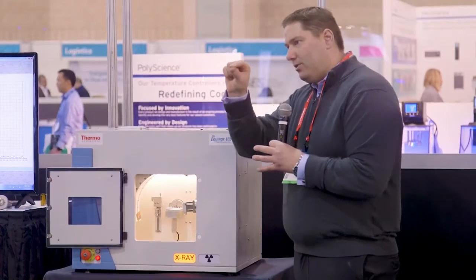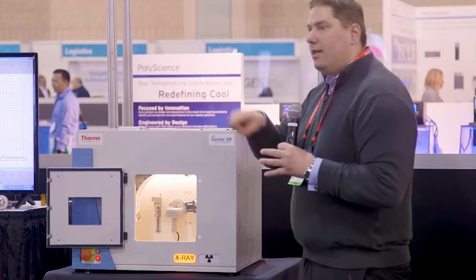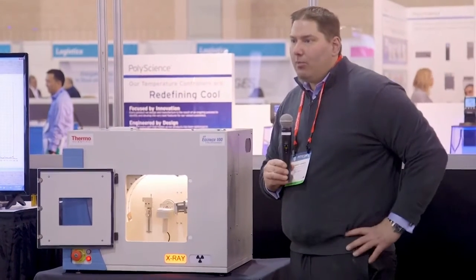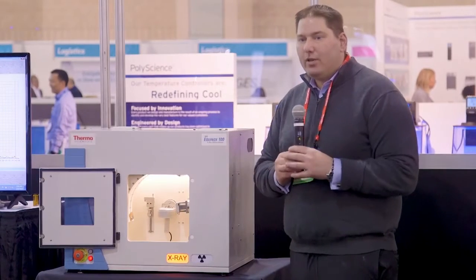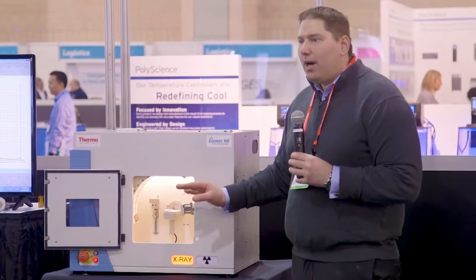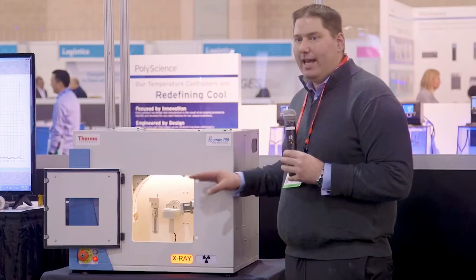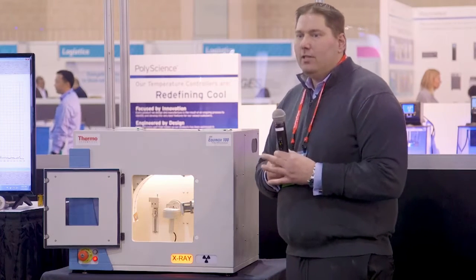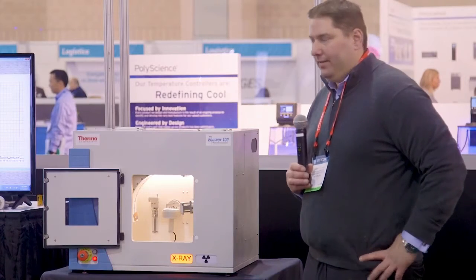So it's basically a pencil line, 150 microns across the sample. And as we're rotating it, that means we're covering an area on the sample of 5 millimeters. So it's a nice, larger area, but still getting a high amount of diffraction energy onto it. It's about the equivalent of 2,000 watts of a standard X-ray tube if you didn't have the mirrors on it. So this is very unique for a benchtop system to have this microfocus on it.